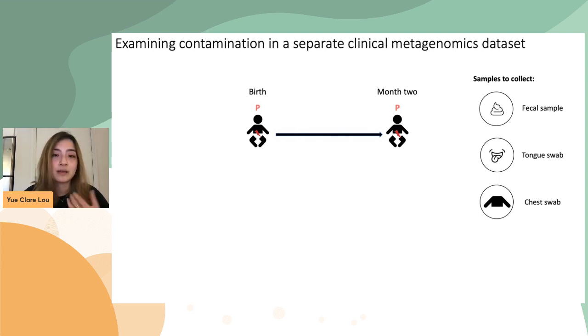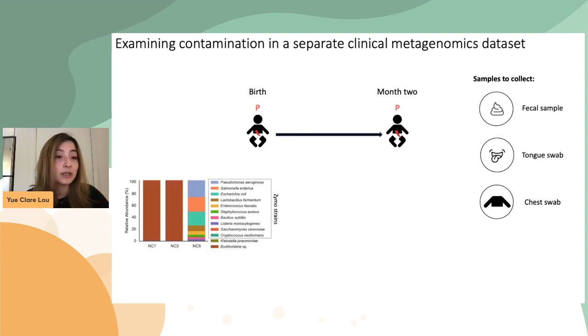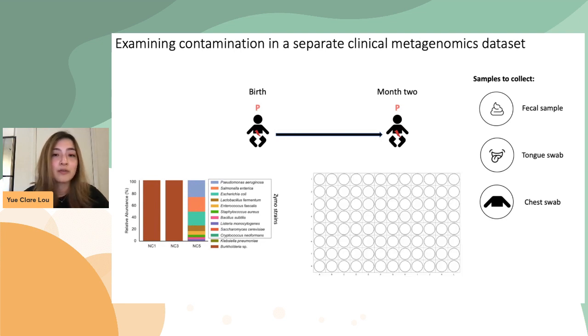And to look for the existence of contamination, we started by looking at reagent-only negative controls first. And as you can see, there was at least 1 organism detected in these 3 sequenced negative controls. We then looked for unusual strain sharing patterns in the context of DNA extraction plates. And in the end, we concluded that unlike the first data set, this data set was primarily contaminated by externally derived contaminants. And these contaminants included the ones that I'm showing you here, which were detected in the negative controls.